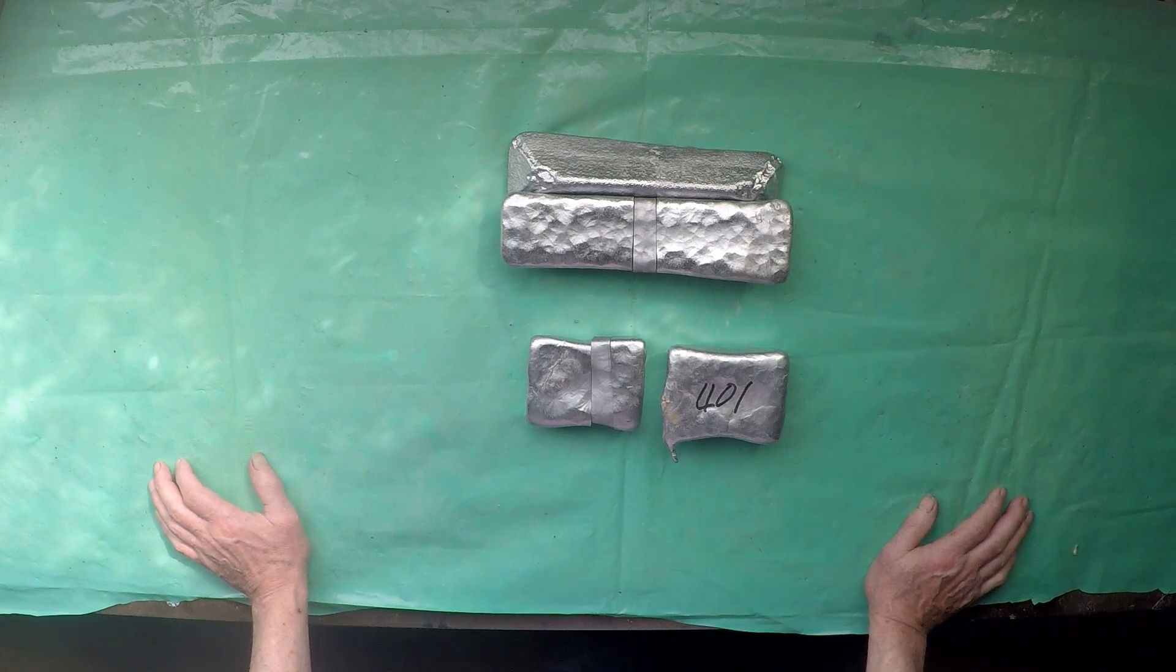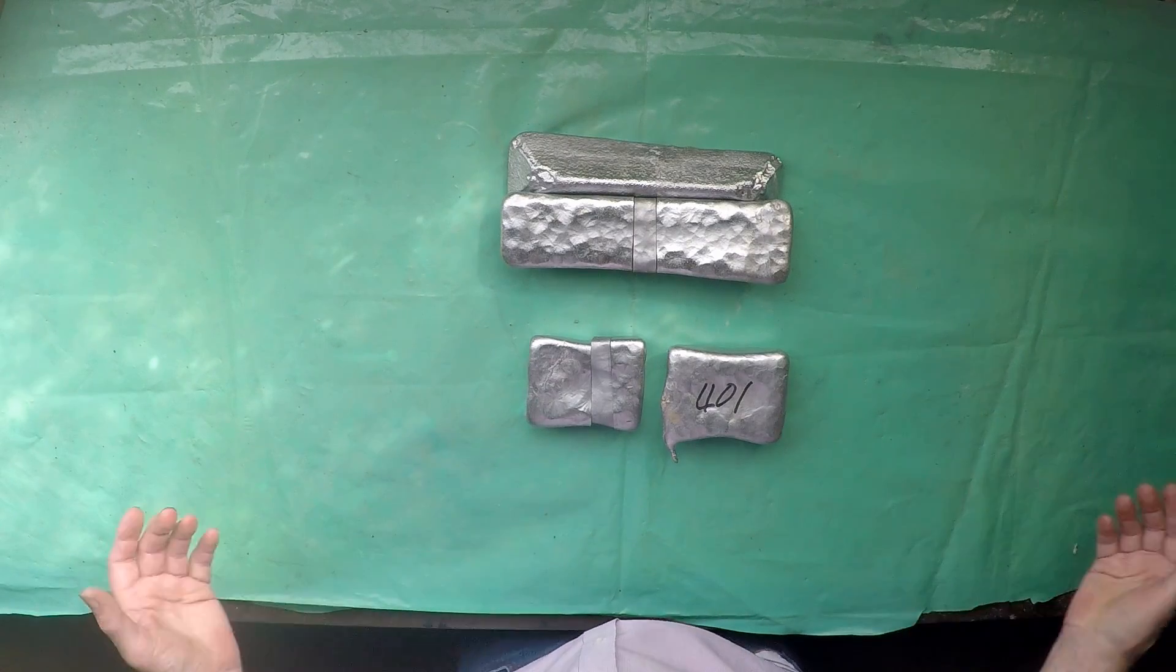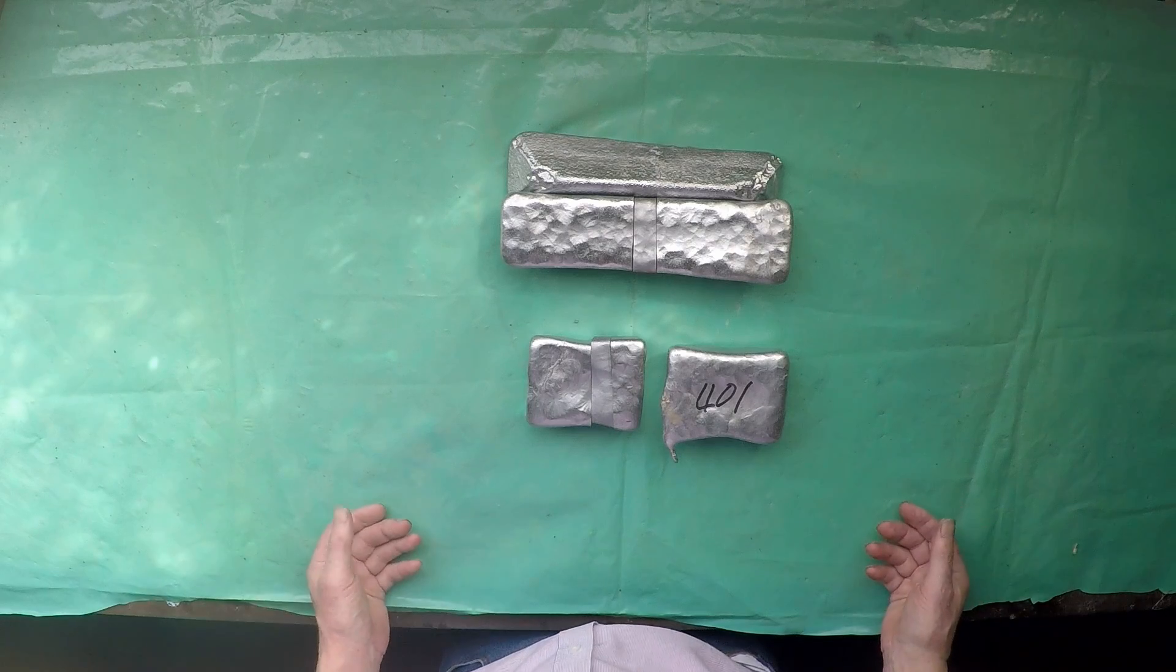This is unusual for this alloy and I've done this many times over 30 years and I've only ever had this once before. Maybe it was an extra humid day and the metal had picked up more gas I don't know.